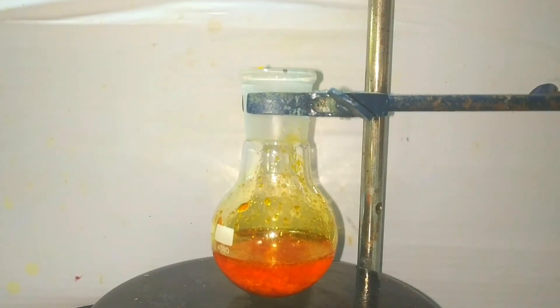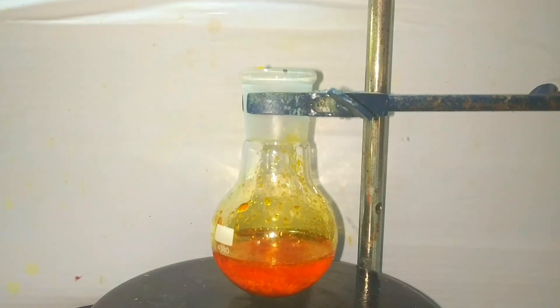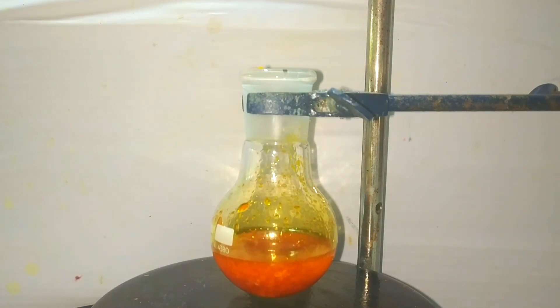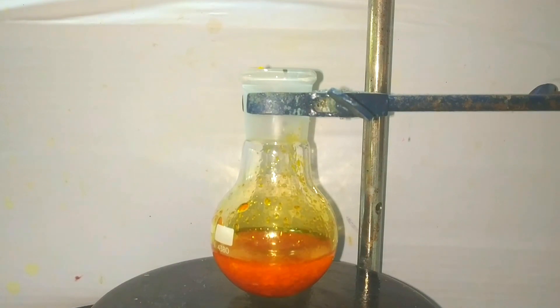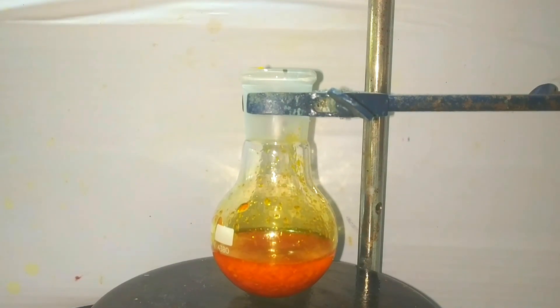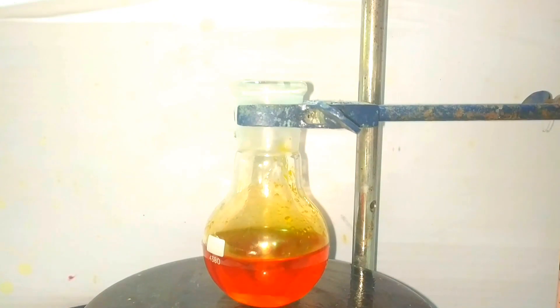My stirring plate took a little long to start, but here the stirring has started. We have to wait for 5 to 10 minutes, and after that we are left with a red, clear solution.